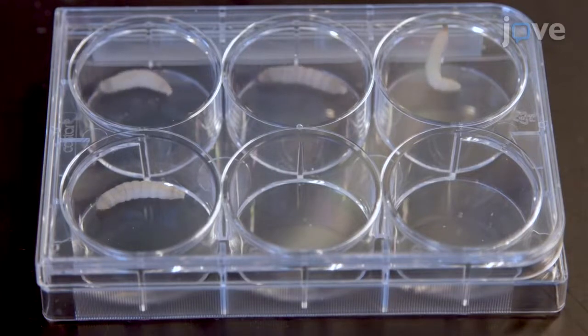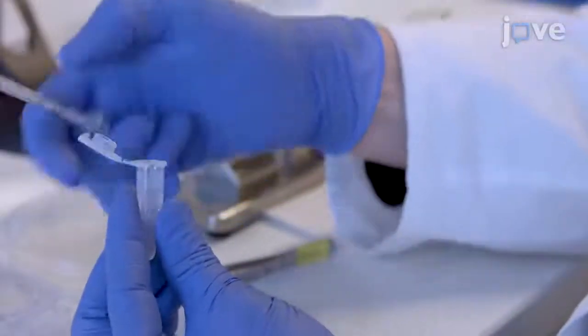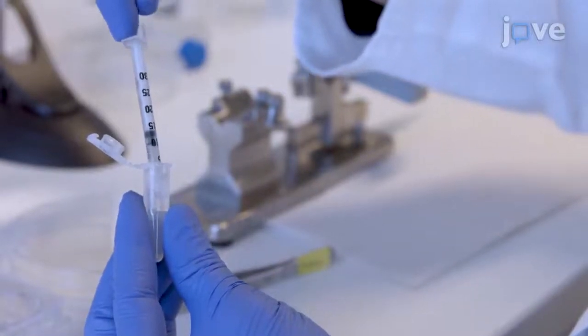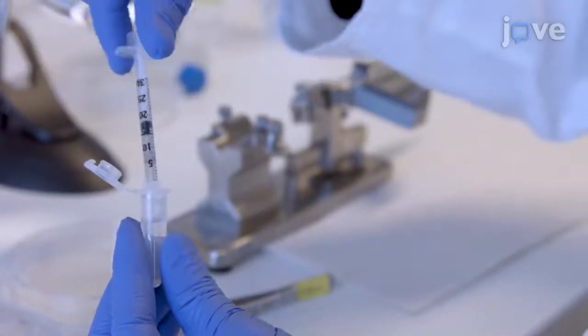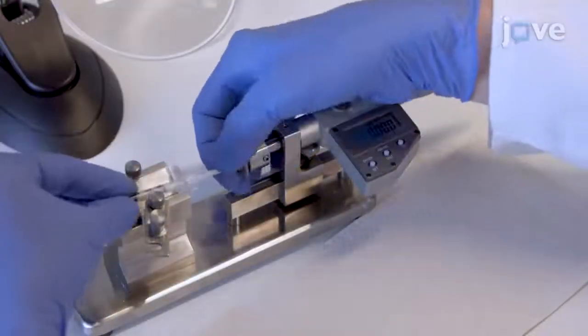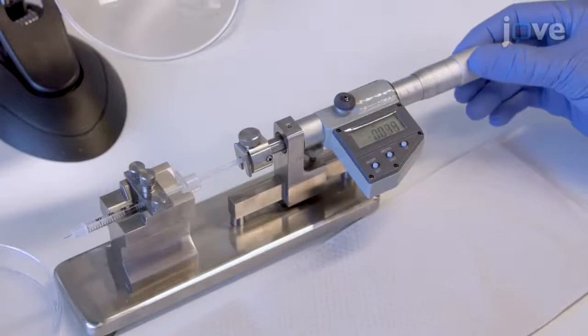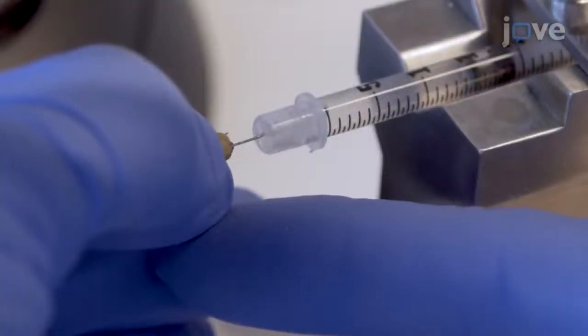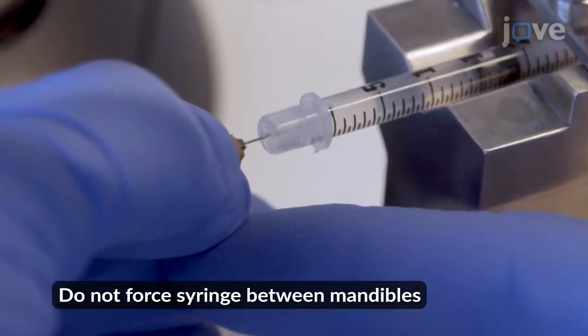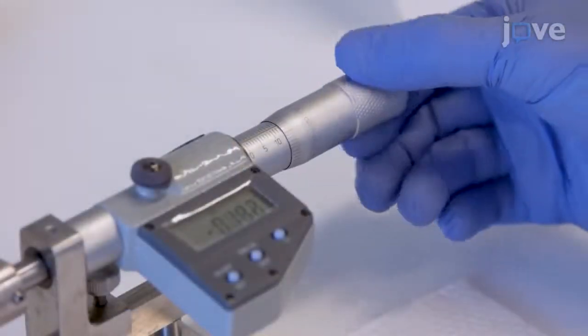To force-feed the larvae, load an insulin syringe with a blunt-ended needle for oral application with 1 × 10⁷ bacteria per 10 microliters of DPBS per larva. Load the syringe into a microsyringe pump. Wait for a larva to open its mouth parts before inserting the syringe carefully between the mandibles and delivering the bacteria.